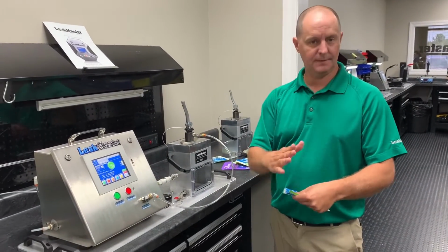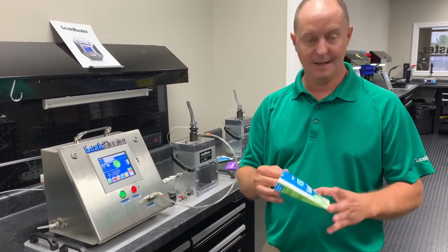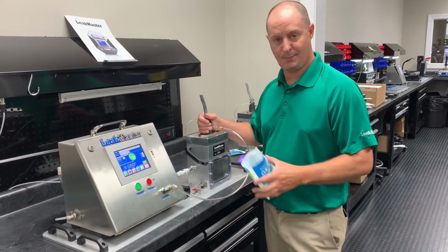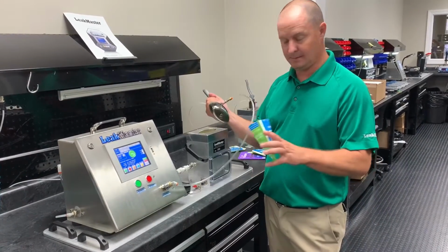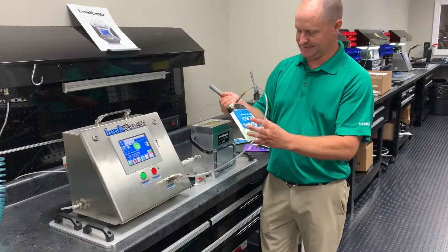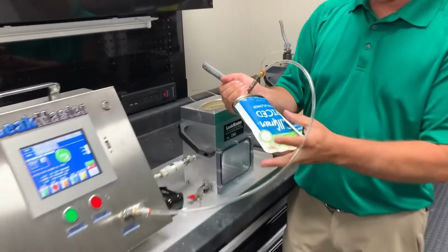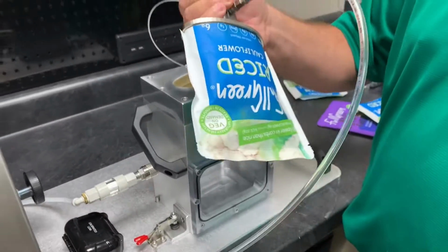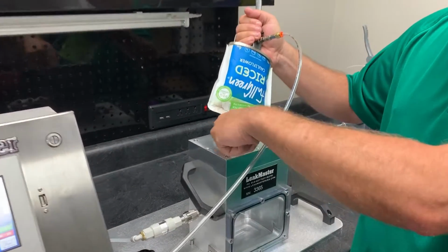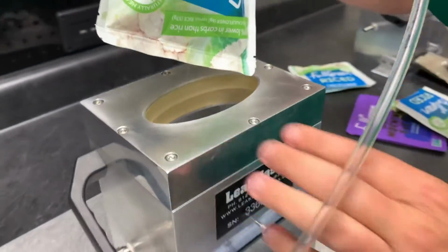And what they'll do is they'll cut this bag, empty the contents, and then wash the product out, and then they're able to leak test it. So what we've got here is a customized seal tool that we've designed that fits on the inside diameter of this bag. And then this product will then be put into this chamber, and then we've got a seal that seals on the outside diameter of the bag as well.